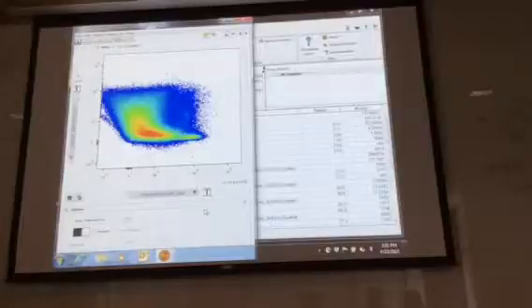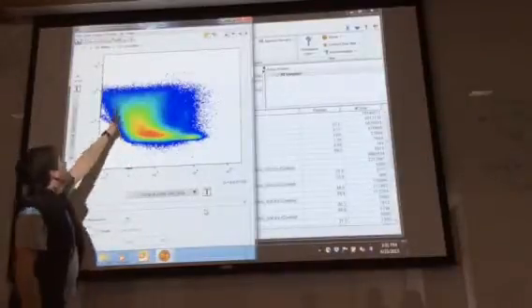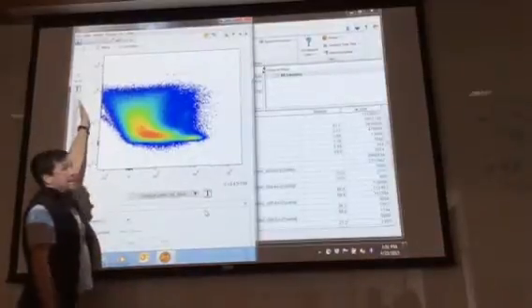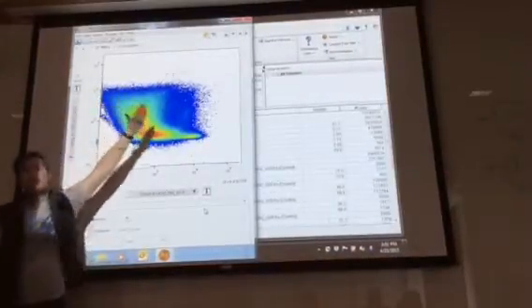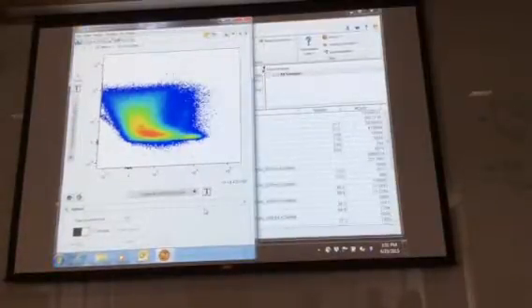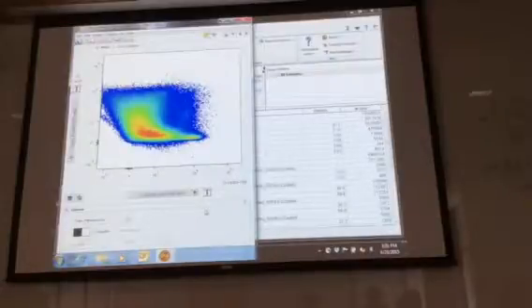not entirely correctly compensated. So in this case, you see things being pulled off here, and they're pulling off at an angle, and they're hitting the y-axis. If you saw that, you'd probably want to go back and check your compensation. So how do you make it better? Because mine kind of does that.